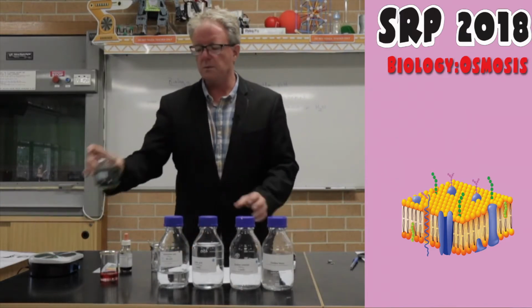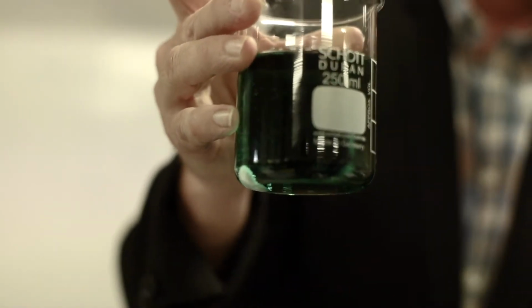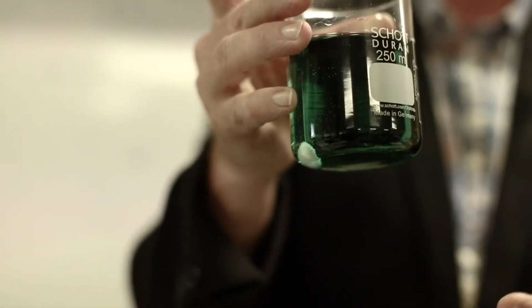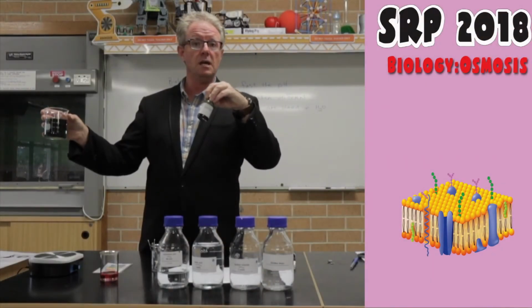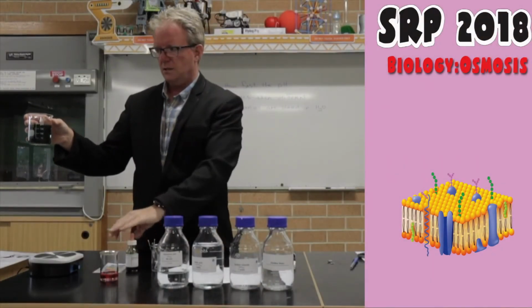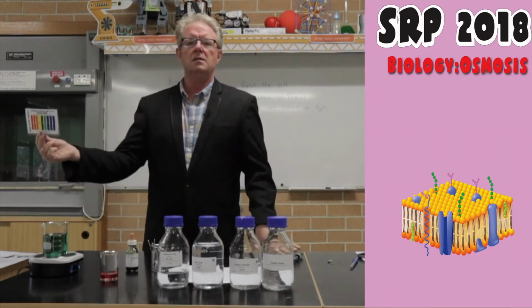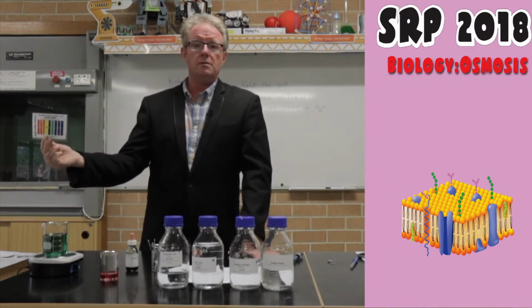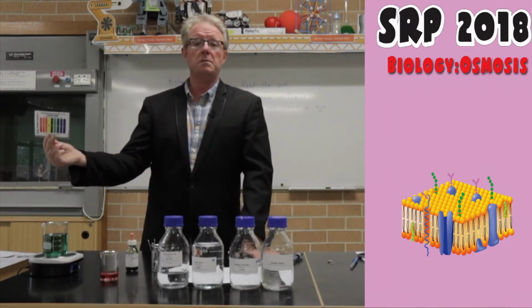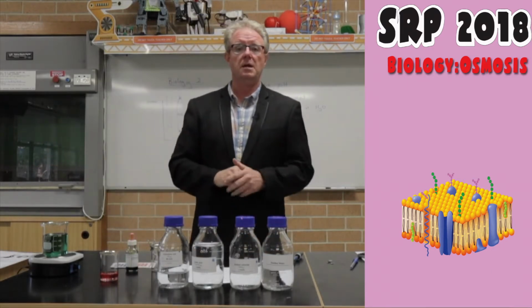We're going to have a variety of chemicals that you need to test. You're going to start off with a beaker, and this beaker is green in colour. The only reason it's green is because I've placed some universal indicator into the water to test its pH. Universal indicator turns green in neutral solutions. Now that's a very broad way of measuring pH. We want to be a bit more specific. We want to use a data logger so that we can be more precise with our pH measurements.